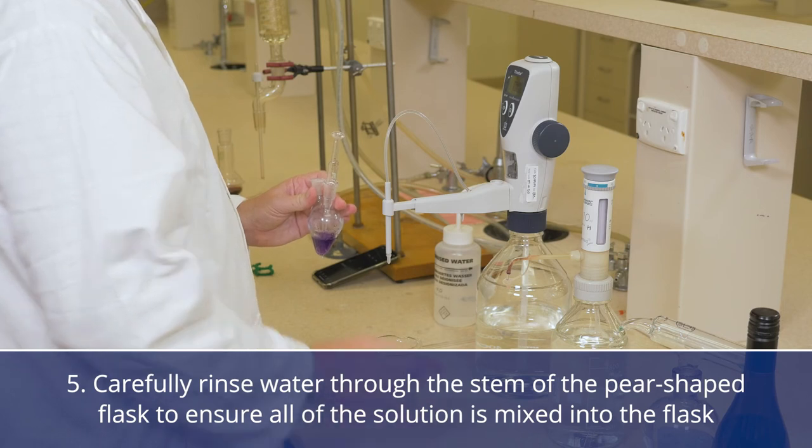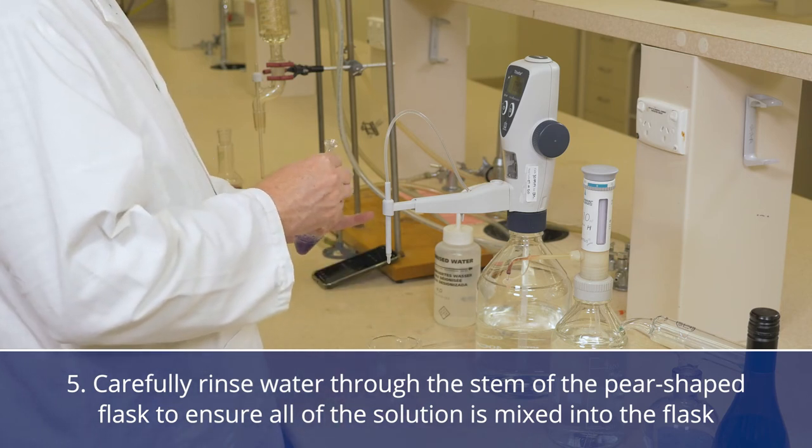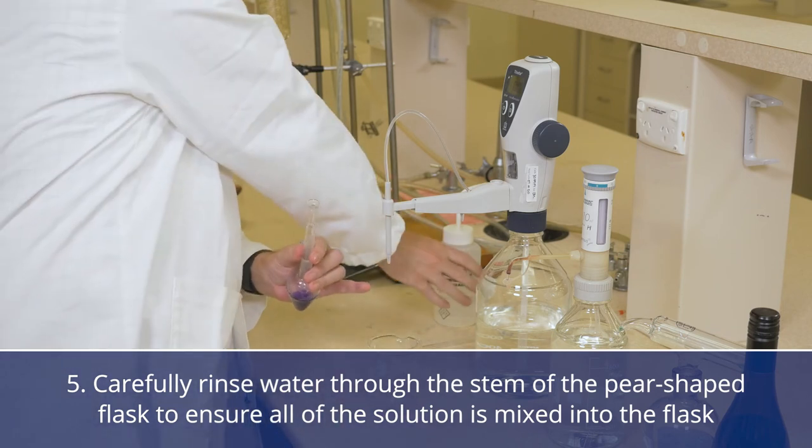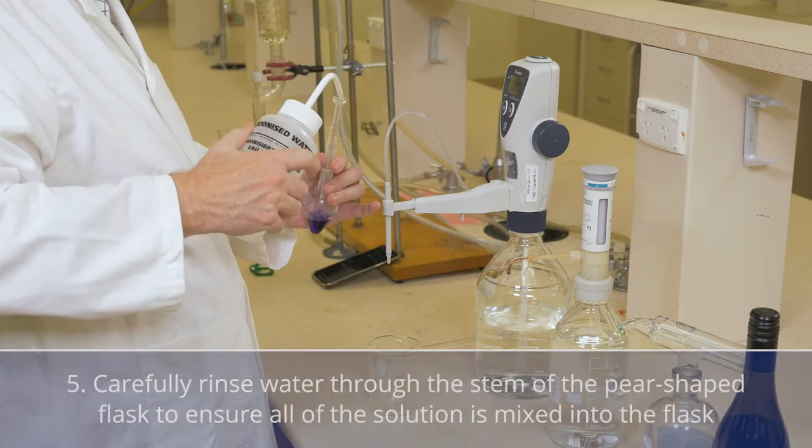Carefully rinse deionized or distilled water through the stem of the pear shaped flask to ensure that all the solution is mixed into the flask.